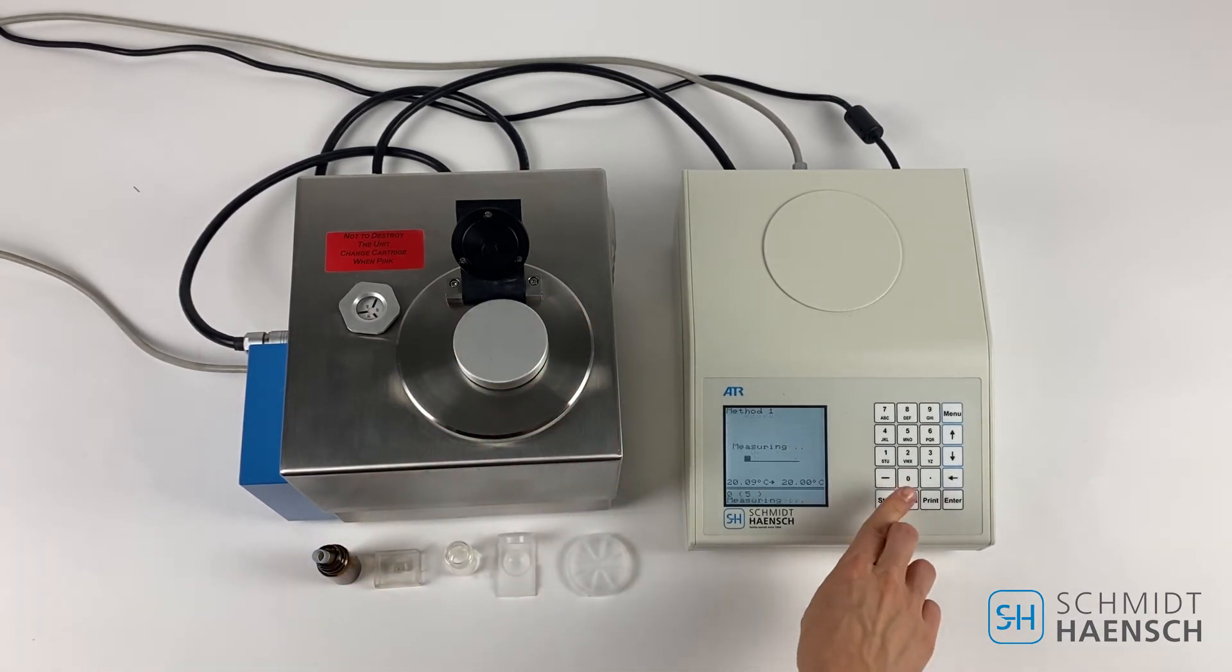We are ready to measure. Press the start button. The temperature is still 20 degrees.